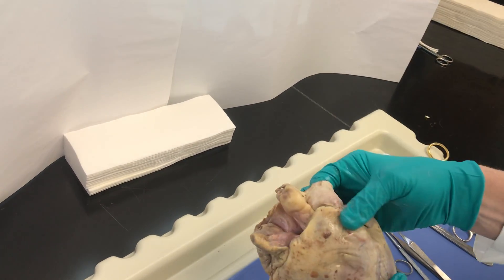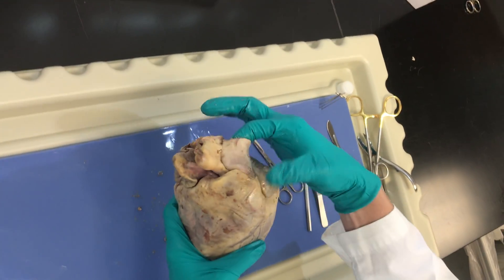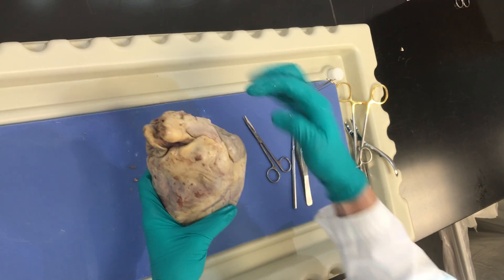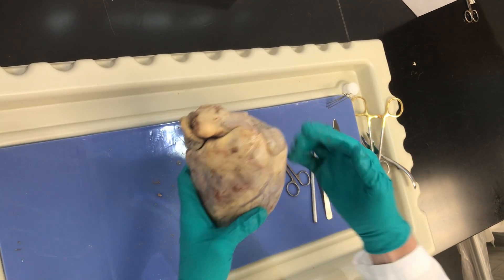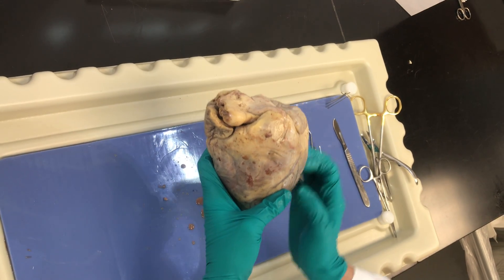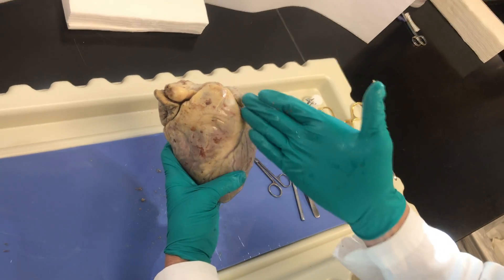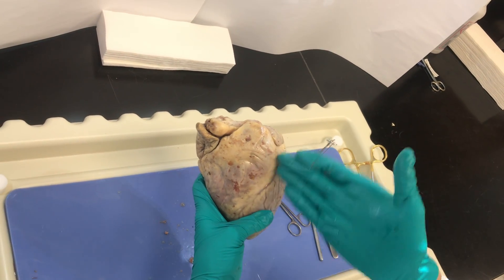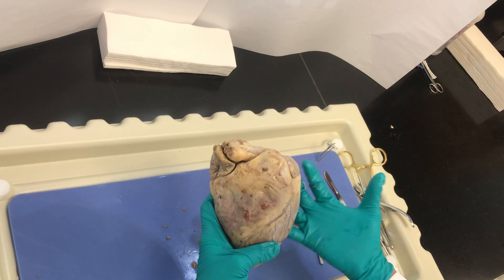What I want to do when cutting in is have an appreciation for where my pulmonary trunk is. I'm going to know that this is the right ventricle, and of course the largest ventricle — the one that creates this apex — is going to be the left ventricle. I'm going to be facing my interventricular vessels and the coronary vessels right here, which is very important for orientation.